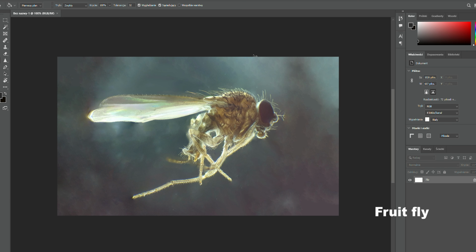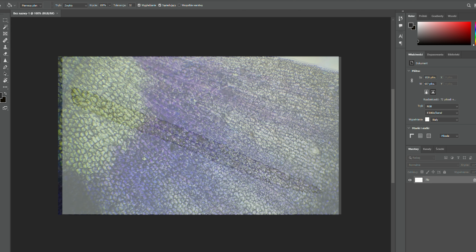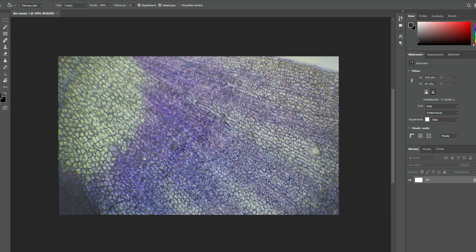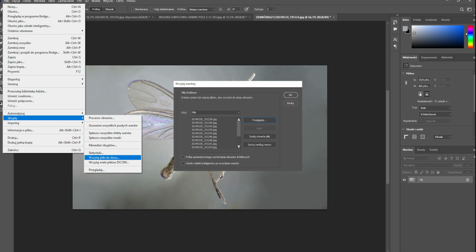Another interesting program for stacking images is Photoshop. Even though it's not specifically designed for this task, it can still do a decent job. The downside is that it's slower, and the final result isn't always perfect. Still, I've used it, for example, to create this image of a fungus gnat. To make a sharp image in Photoshop, start by going to File, Scripts, and Load Files into Stack. After selecting the images, click OK.